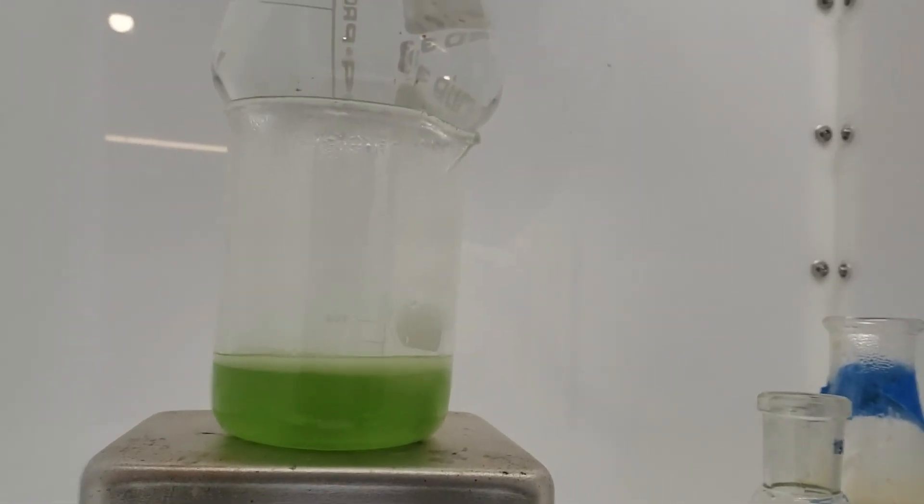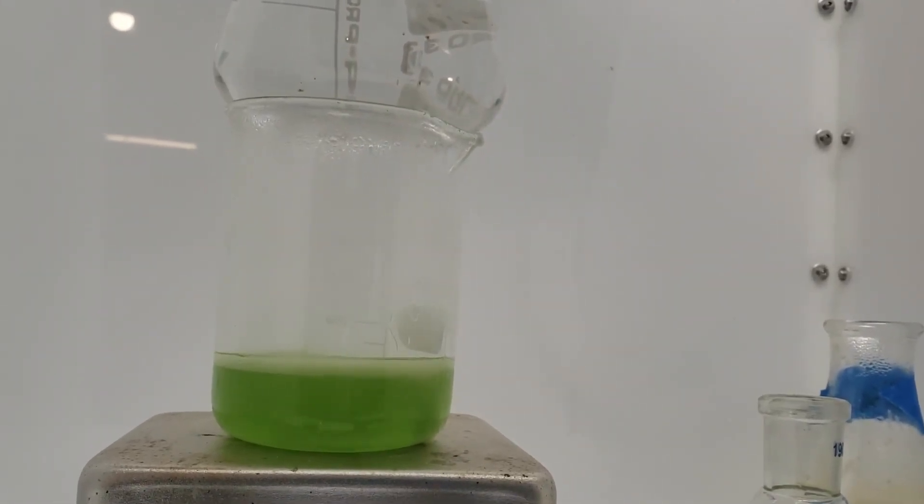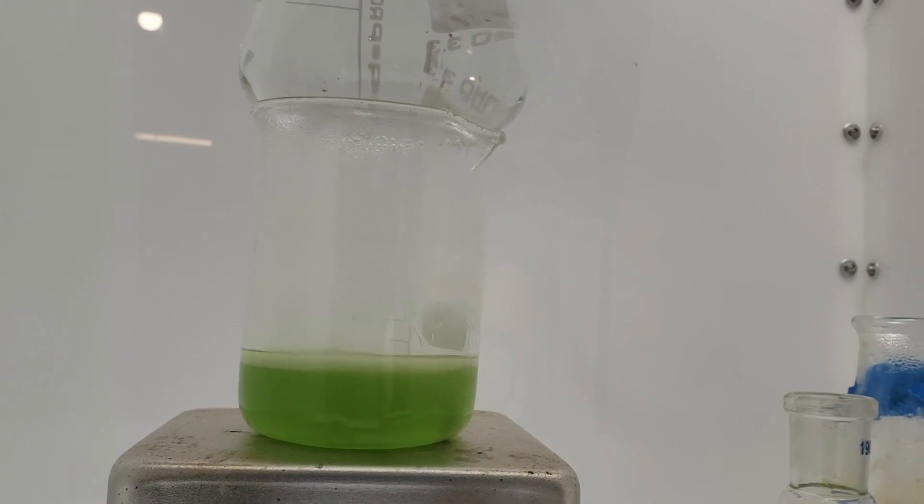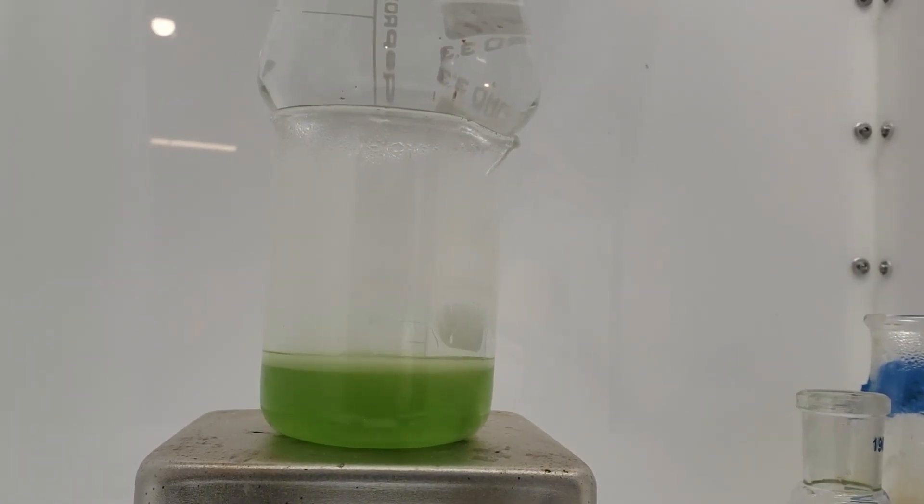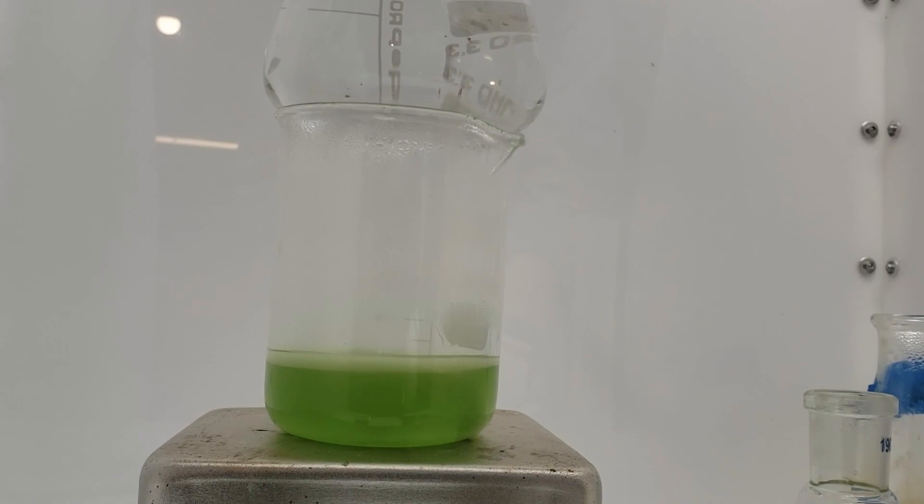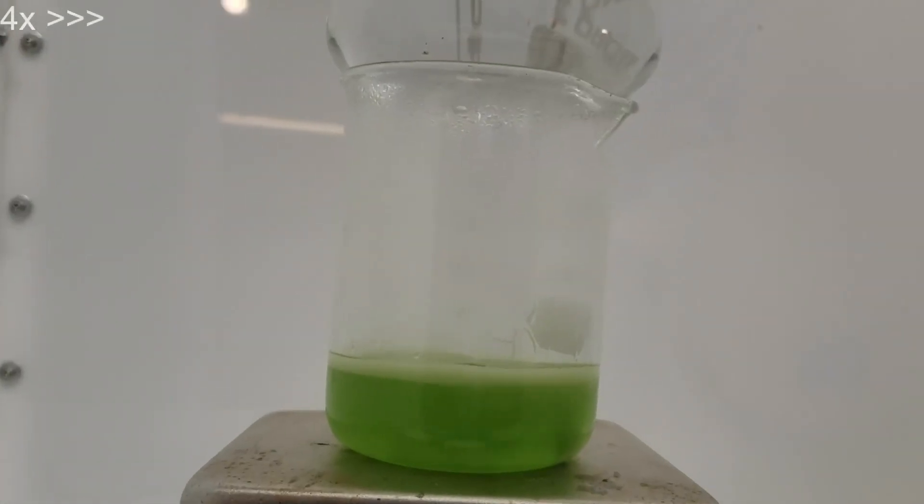Midway through, the reaction was starting to foam over the 100 milliliter flask, so it was transferred to a 250 milliliter beaker with a flask of cool water on top. 10 milliliters of hydrochloric acid was also added to top off anything that had been lost.